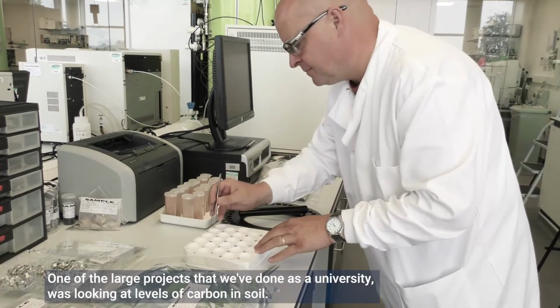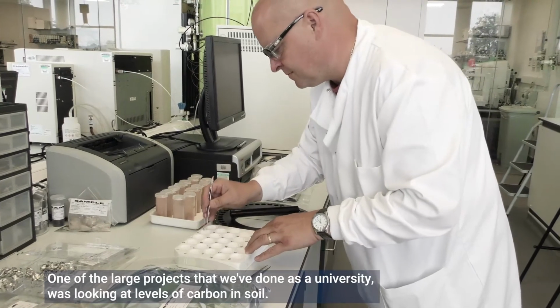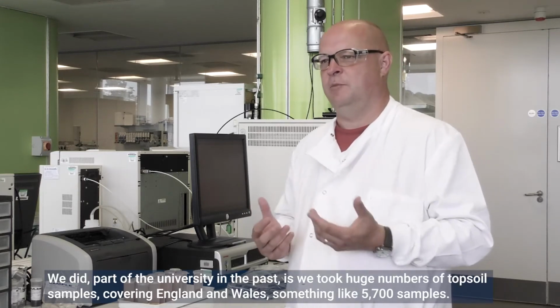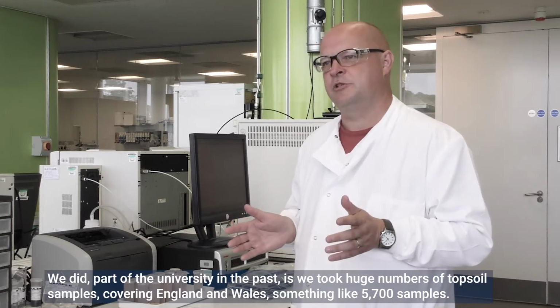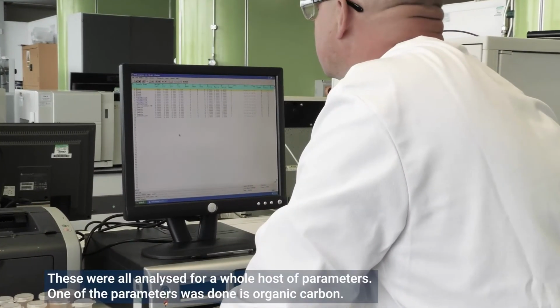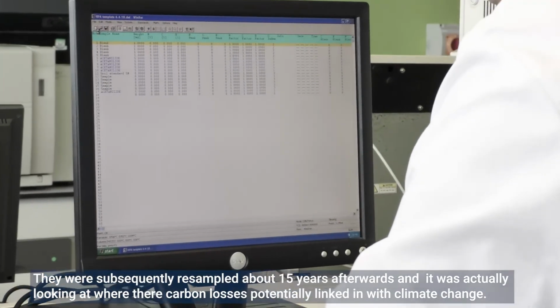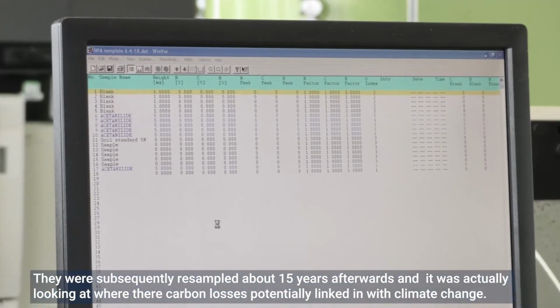In one of the large projects that we've done as a university, we were looking at levels of carbon in soil. Part of the university in the past took huge numbers of topsoil samples covering England and Wales, something like 5,700 samples. These were all analysed for a whole host of parameters. One of the parameters was organic carbon. They were subsequently resampled about 15 years afterwards. And what it was looking at was whether there were carbon losses potentially linked with climate change.